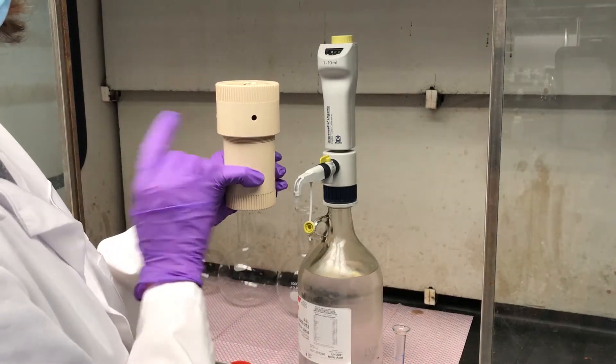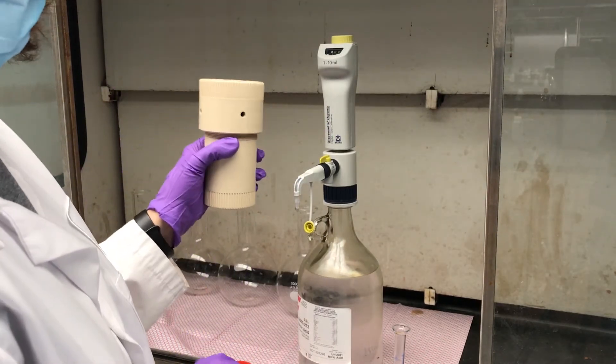Screw on the lid. A little bit tight, not too tight. Now this is ready to go in the microwave.